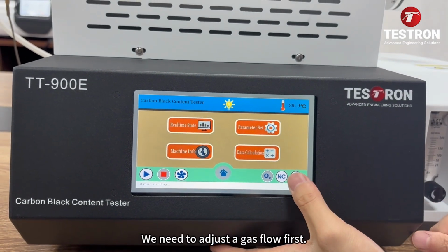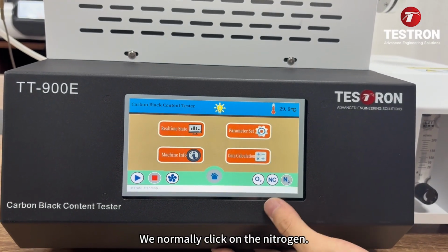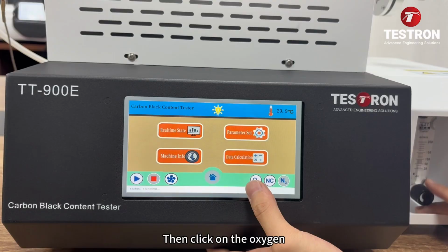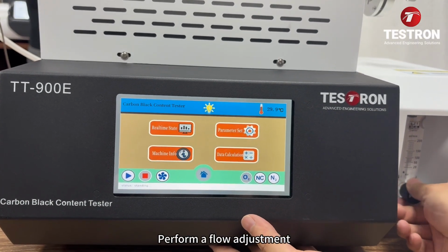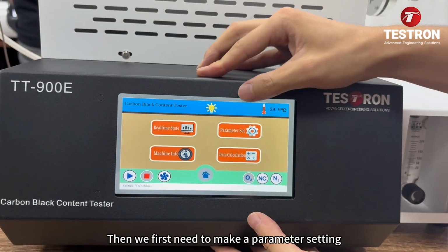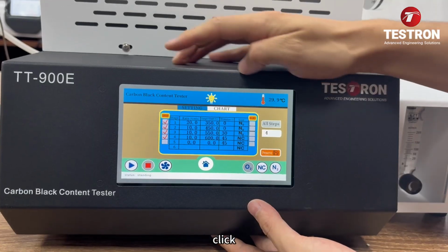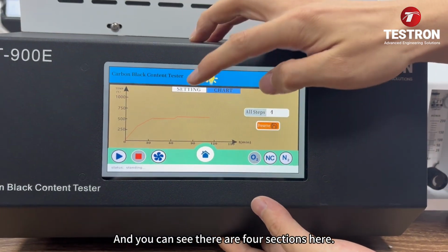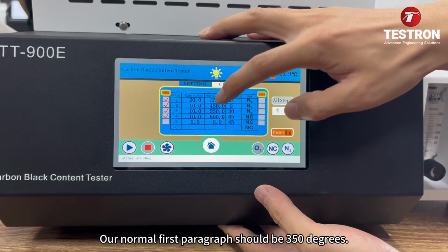We need to adjust the gas flow first. We normally click on the nitrogen, perform a flow adjustment, then click on the oxygen, perform a flow adjustment. Then we first need to make a parameter setting. Click. And you can see there are 4 sections here. Our normal first paragraph should be 350 degrees.